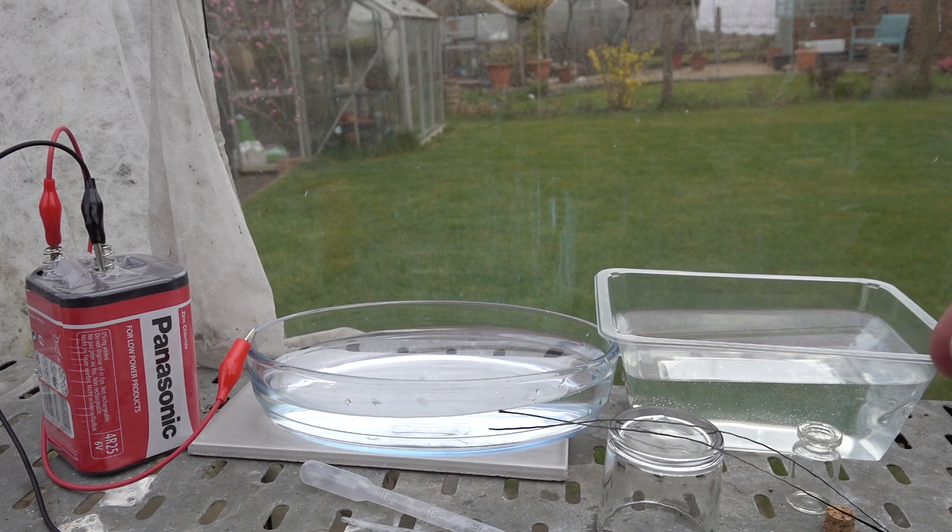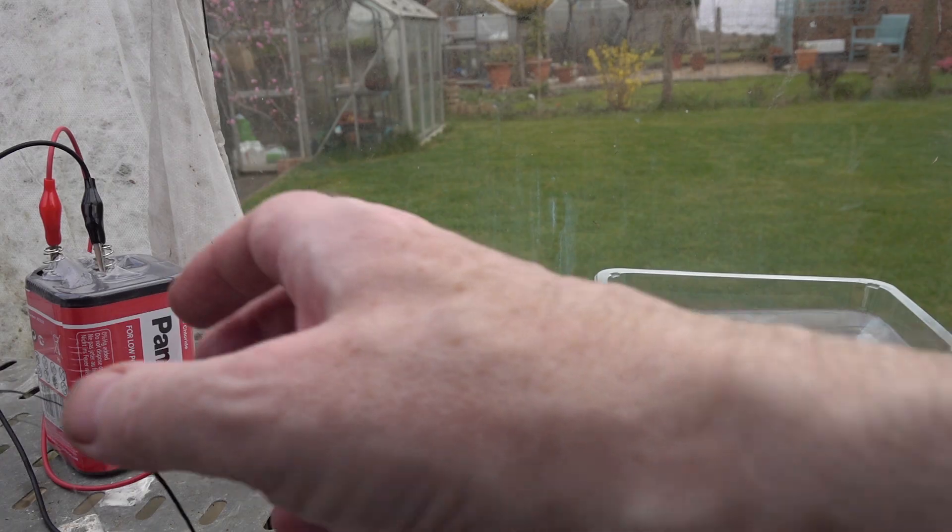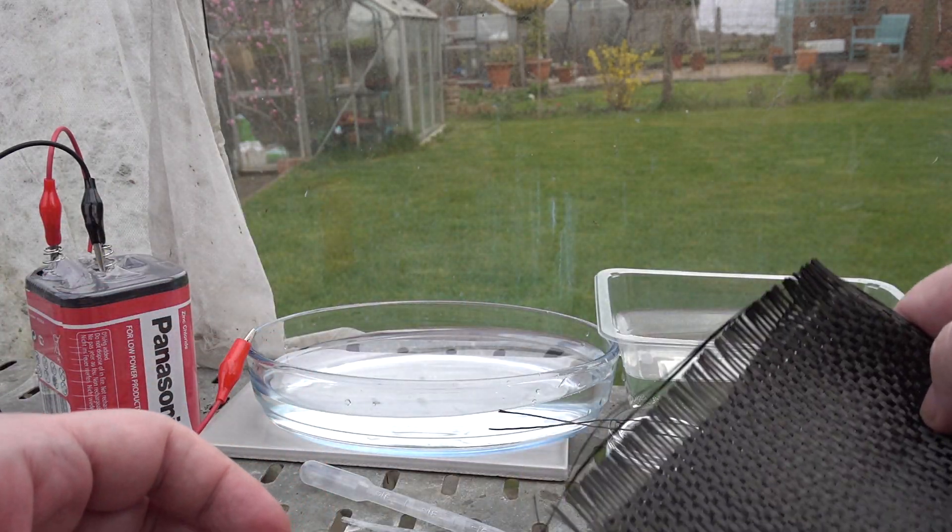In this video we're going to show how to make an electrode which can be used to collect gas in electrolysis experiments.